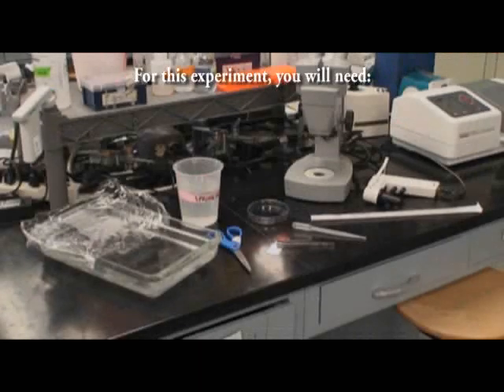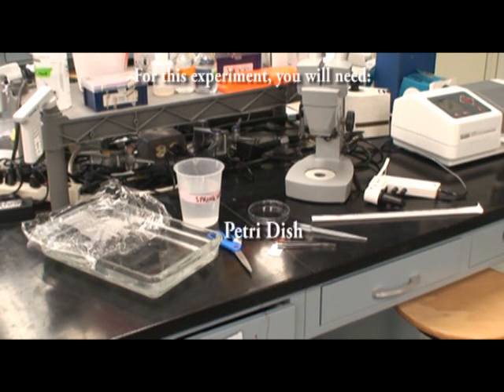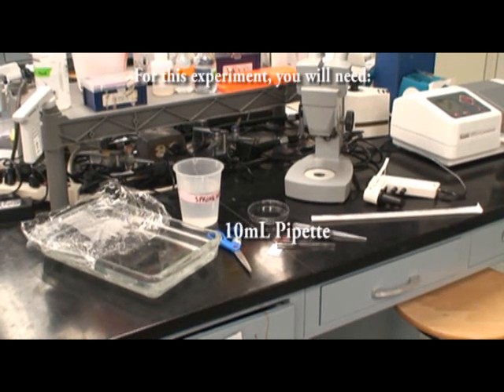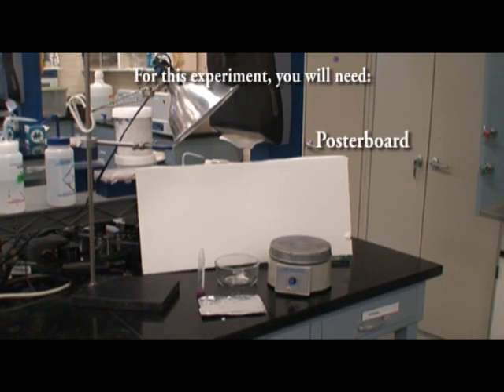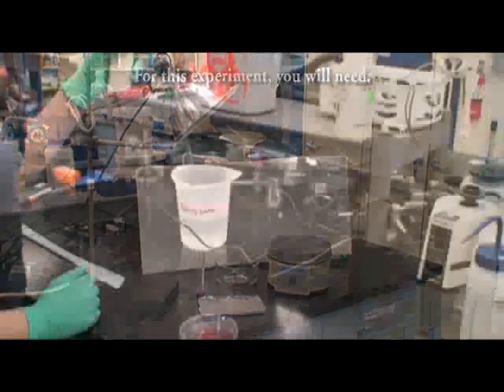Observing planaria. For this experiment you will need planaria, spring water, scissors, a petri dish, forceps, a transfer pipette, a 10 ml pipette, a pipette man, a dissecting microscope, a light assembly, a poster board, a stir plate, a stir bar, a glass bowl, aluminum foil, and a 15 ml conical tube.